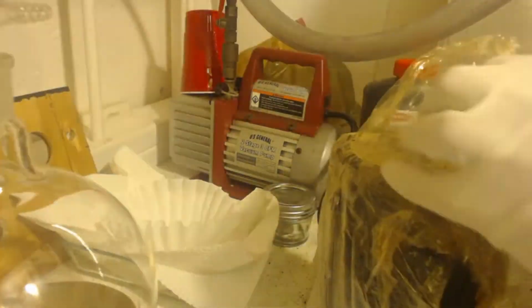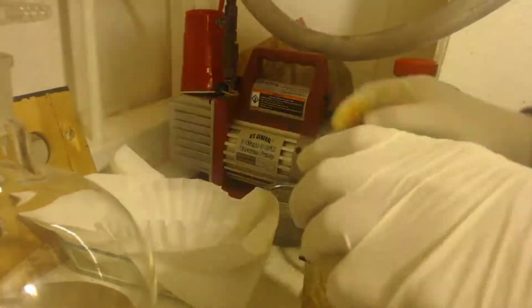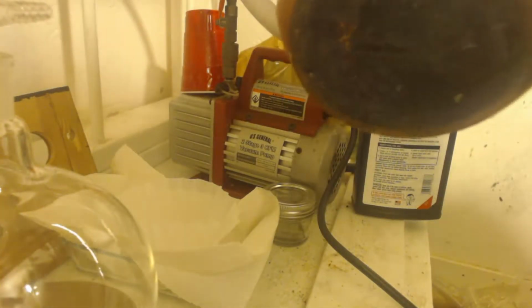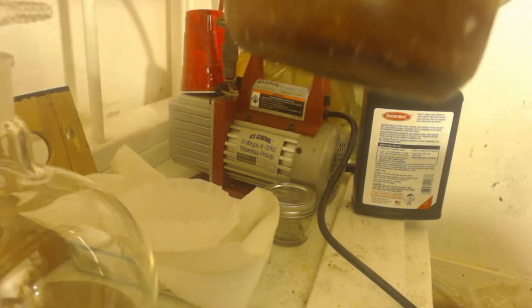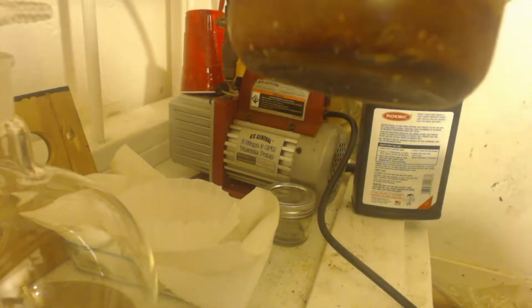You can see how easily it leaks. I don't know if you can see that, but that's a clear bag, although now it's like black as heck. Might have to let that thaw. You can see it's a bunch of water, but down at the bottom there's just a little bit.